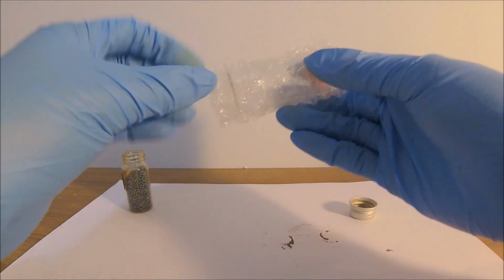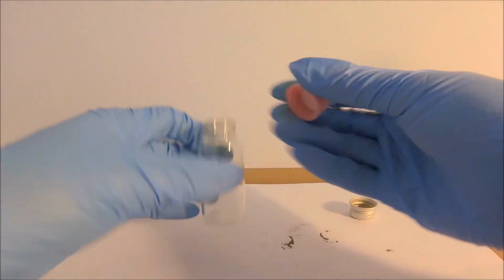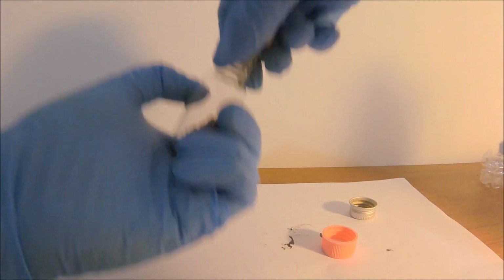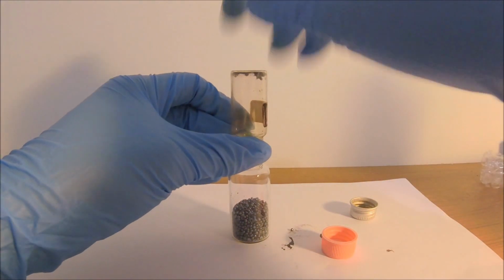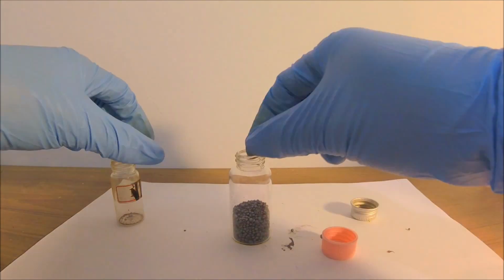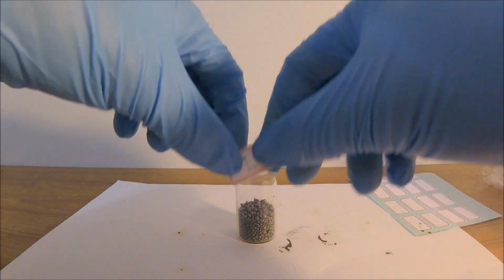To save whatever I have left in there, I am going to have to transfer the iodine into another vial with a suitable cap. Sometimes I have to learn things the hard way. And a good chemist always labels their stuff.